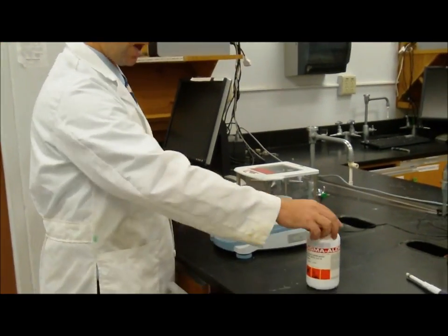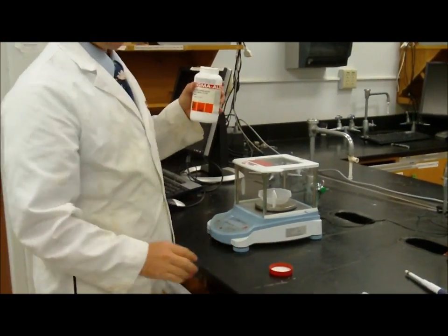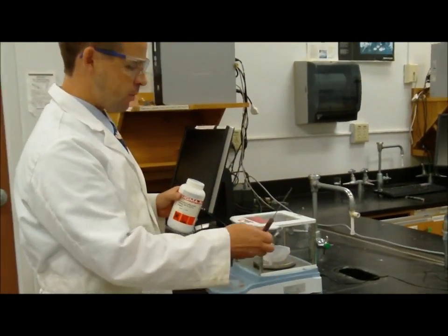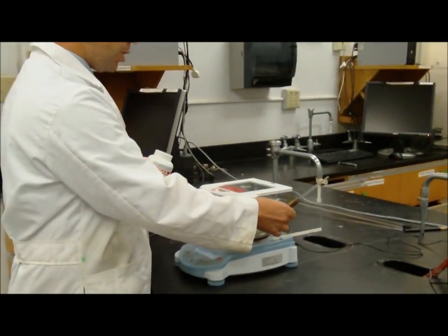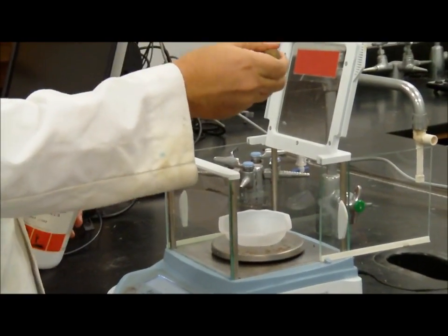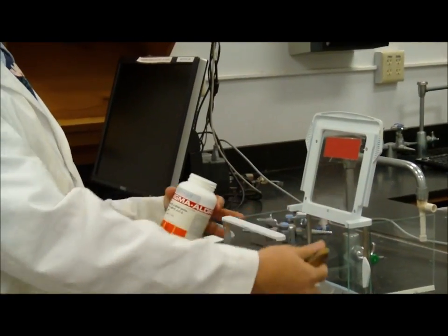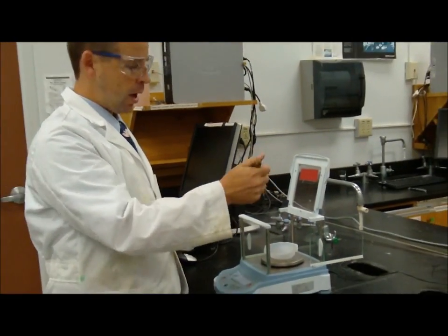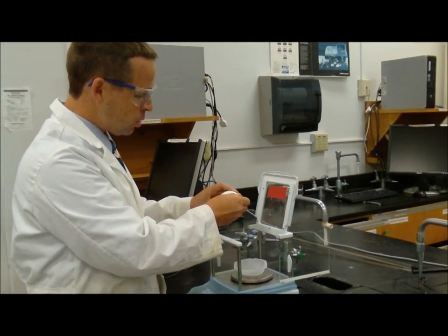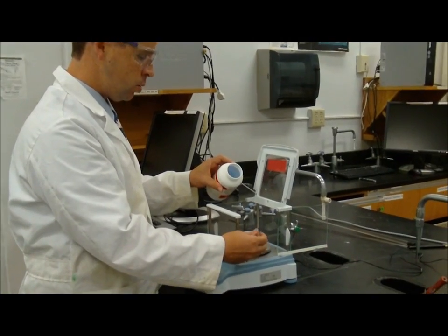So, if I'm going to add some copper sulfate onto this balance, let's say I want to weigh out 0.1 grams of copper sulfate. I'm going to move this door and this roof out of the way. I don't want to add it from way up here, because when I do that, I have a chance of sprinkling out copper sulfate all around outside of the tray, which will cause a mess. So when I add it, I'm going to do something along these lines, where I bring it down nice and low, and then I turn it into the weigh boat.